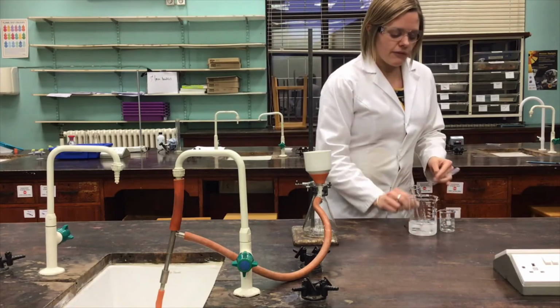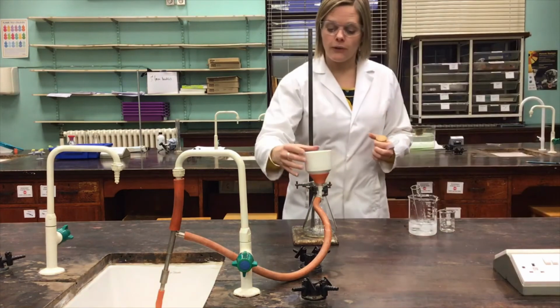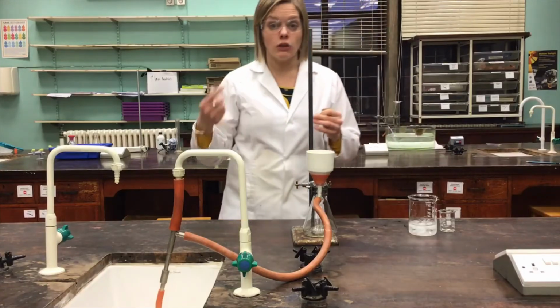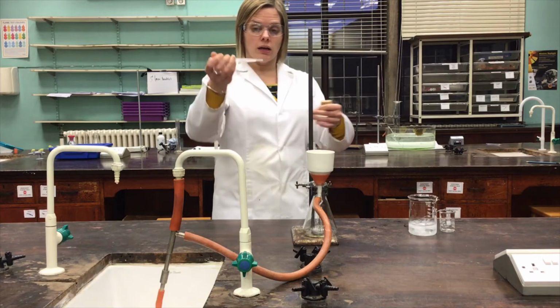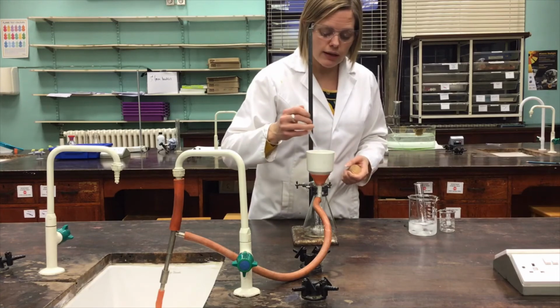So the final step for this part of the method is to make sure that filtration gives us the purest possible product that we can have. And so again, because we separated the aspirin from the soluble impurities using the recrystallization method, I'd just like to take a quick, again, little pipette full of that ice cold ethanol and just give this a rinse.